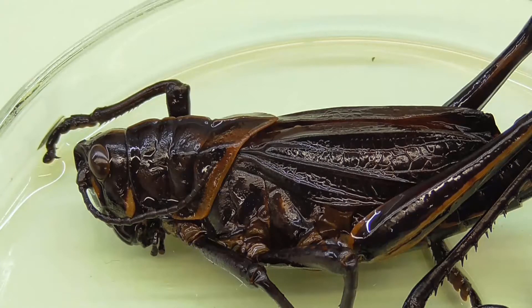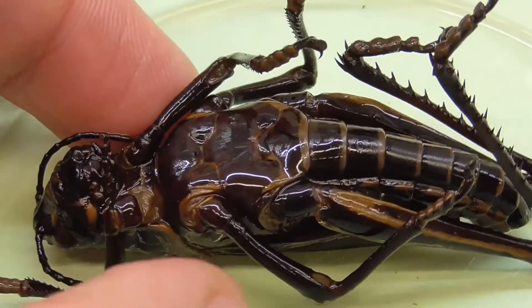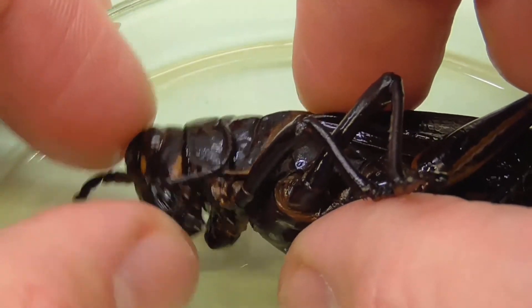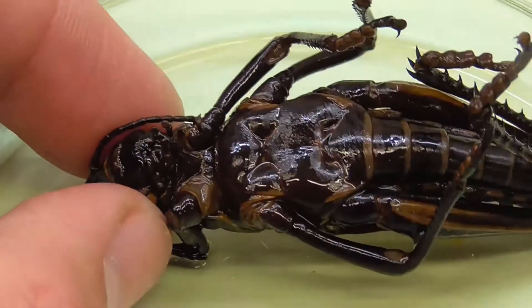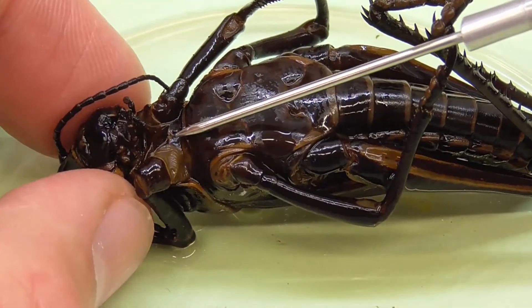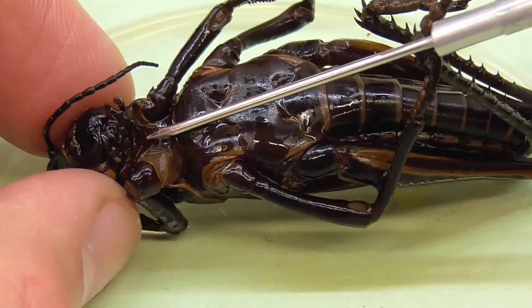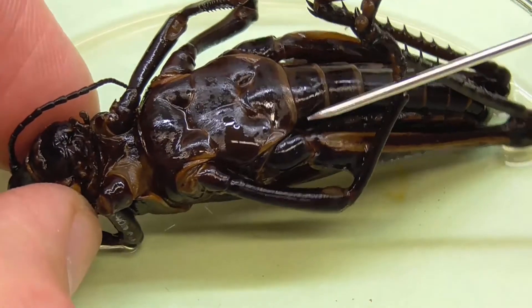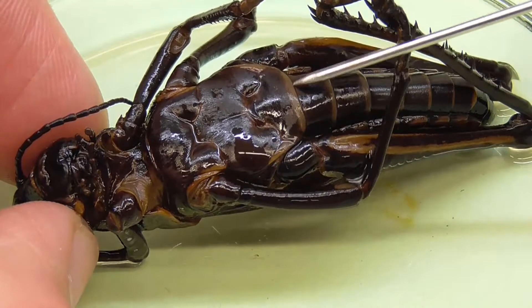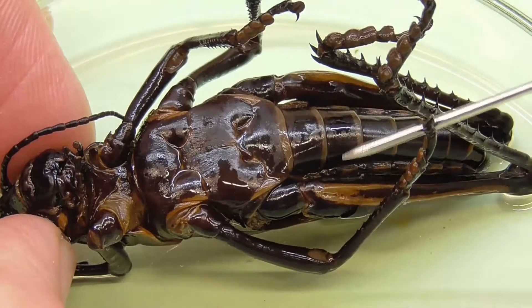To work out which part starts where, the easiest way is to turn it over, look at the ventral surface, and find where the legs are. The neck area is where the head is, and then the three pairs of legs that adult insects have come off the thorax. The legs and the wings come off the thorax — the first, second, and third pairs. The thorax runs from the neck down to a line where it turns into the abdomen. So we've got the head, the thorax, and the abdomen.